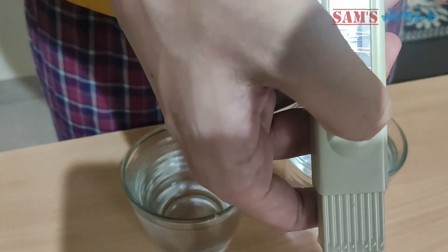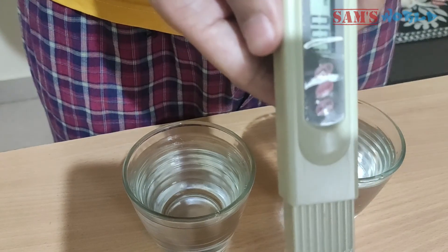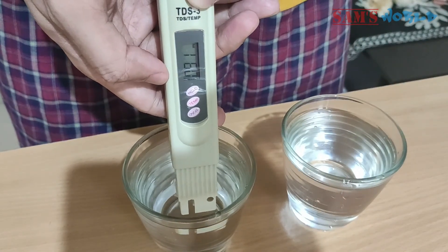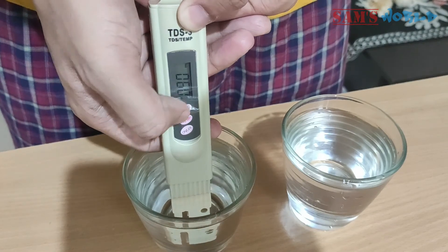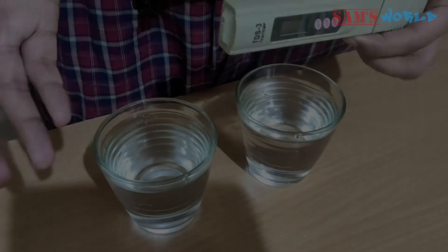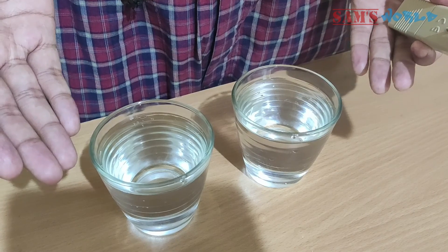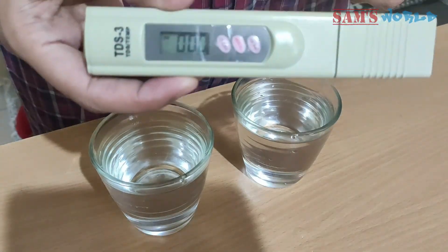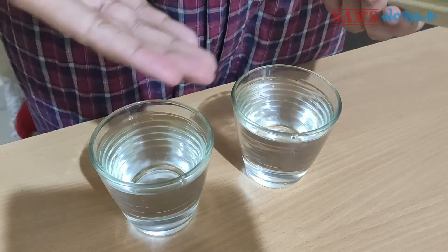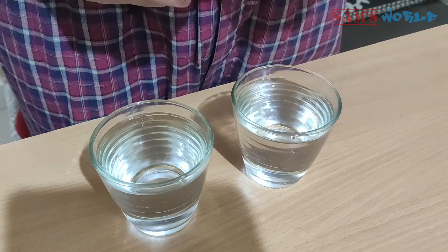Now I will reset the meter again and insert it into our drinking water. You can see the reading is around 90. So the TDS level of each water is different, which means the TDS meter is working perfectly. We also saw the TDS level is below the 150 mark, which is considered excellent for drinking purpose.